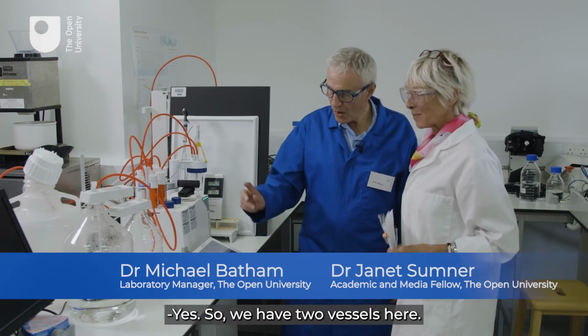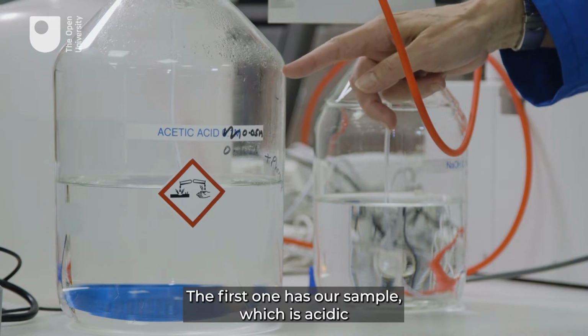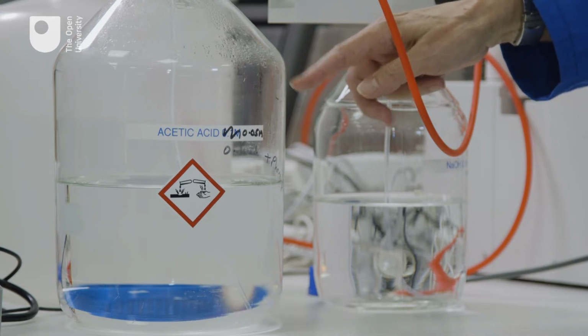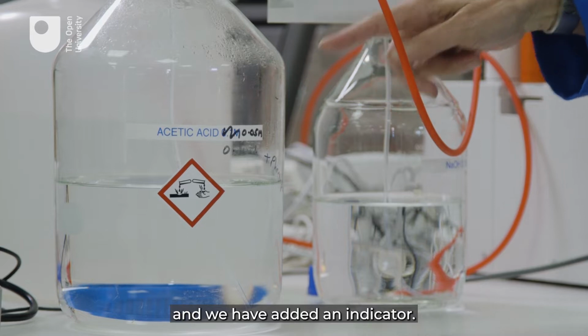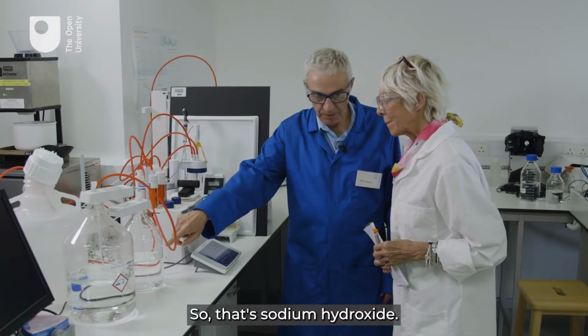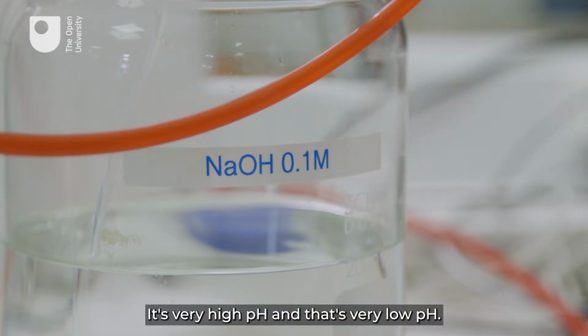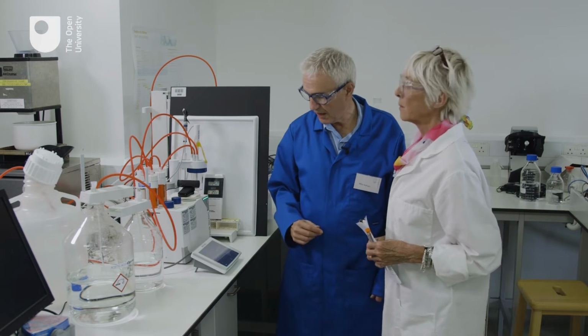Yes, so we have two vessels here. The first one has our sample, which is acidic, and we have added an indicator. And the second one is our base, so that's sodium hydroxide. It's similar to what you have in the oven cleaner. It's very high pH and that's very low pH.